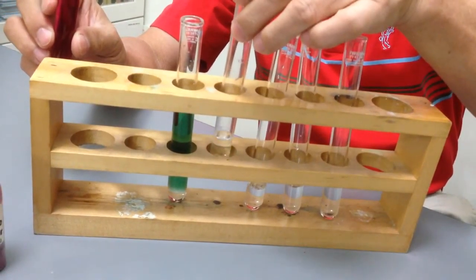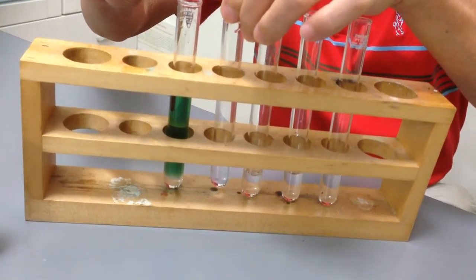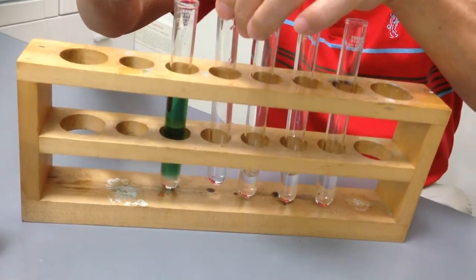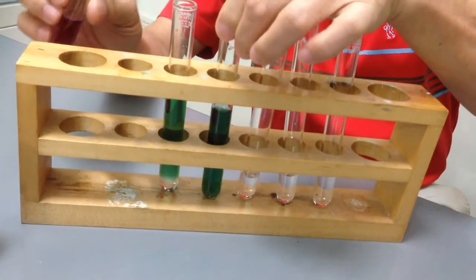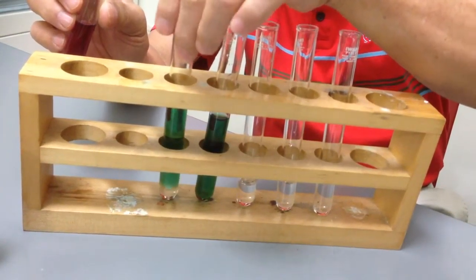And then we are going to add into aqueous ammonia. And aqueous ammonia, the pink color will turn, oh also green. A little bit darker green than this.